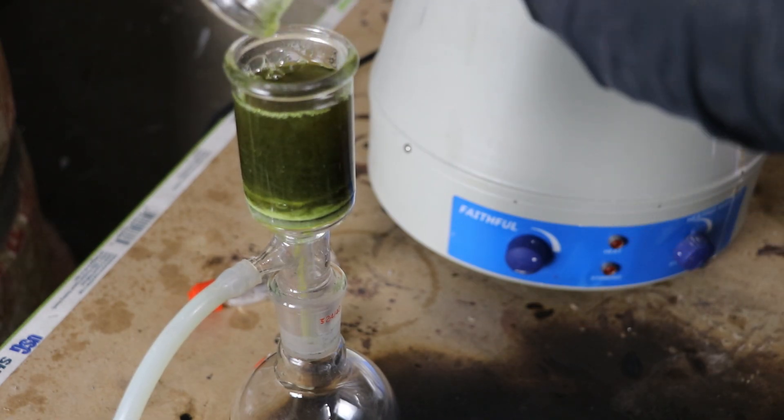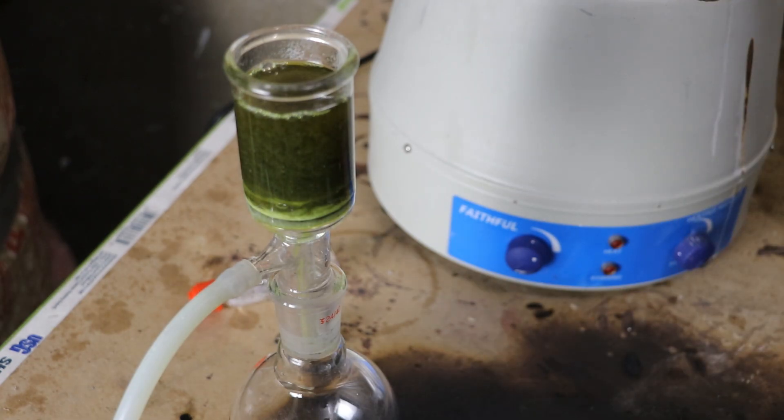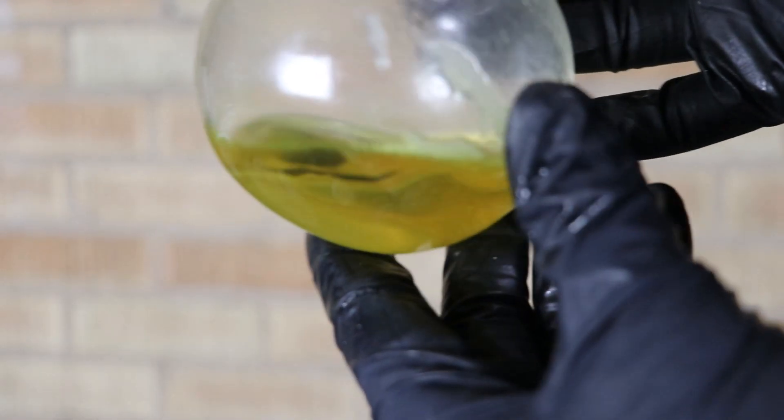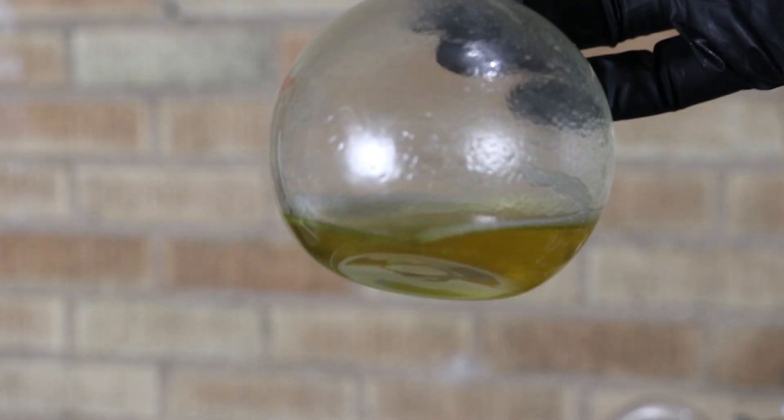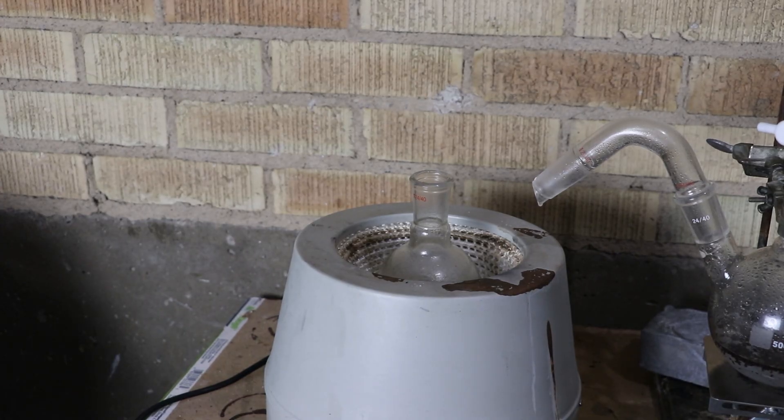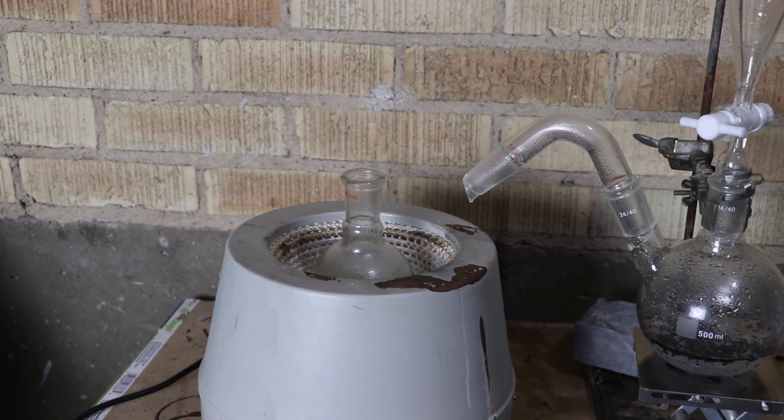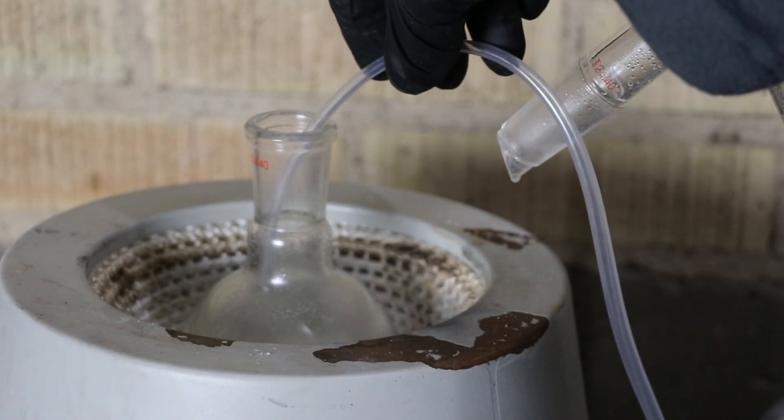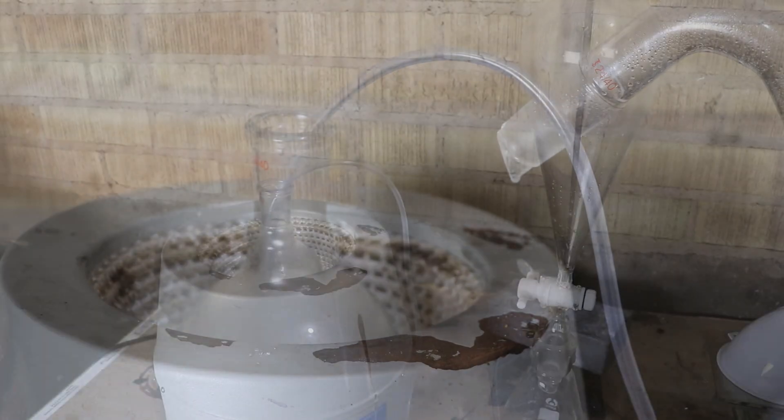So you want to get rid of it before the peroxide is formed. Apparently we got a bunch of stuff that never dissolved. So now that it's all filtered, I'm going to put it back into this. Let's drop in a clean stir bar. Focus the camera. I'm just going to let it sit here and absorb some air. Might even set up a bubbler and kind of force the air into it. Probably not necessary. Got an air pump here. Blow some air into the chamber. Just to help it out. Okay.